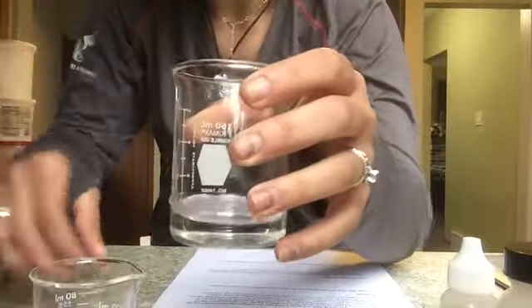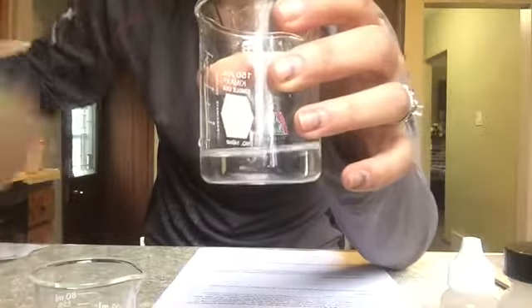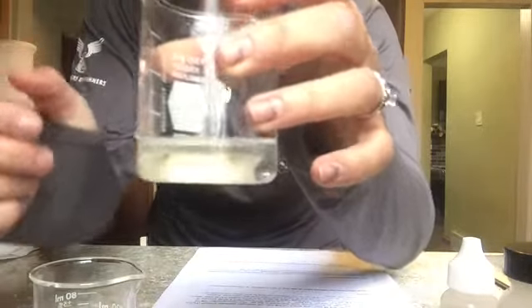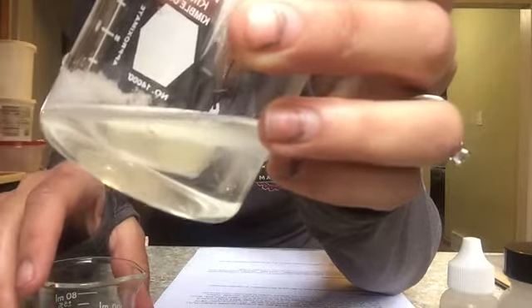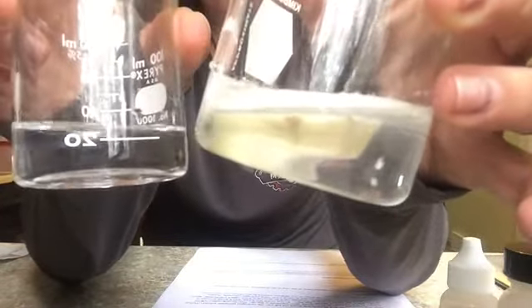But in my second beaker, if we add a catalyst, which is a piece of a potato, so I have a potato, cut a little part off of it, if we put that in and let it sit, do you guys see the bubbles coming off of it? So you can really see all of those bubbles coming off of it, whereas the other one does not have those bubbles coming off. So it's something that's happening anyway, but we added a catalyst. So a catalyst is speeding up that rate of reaction.